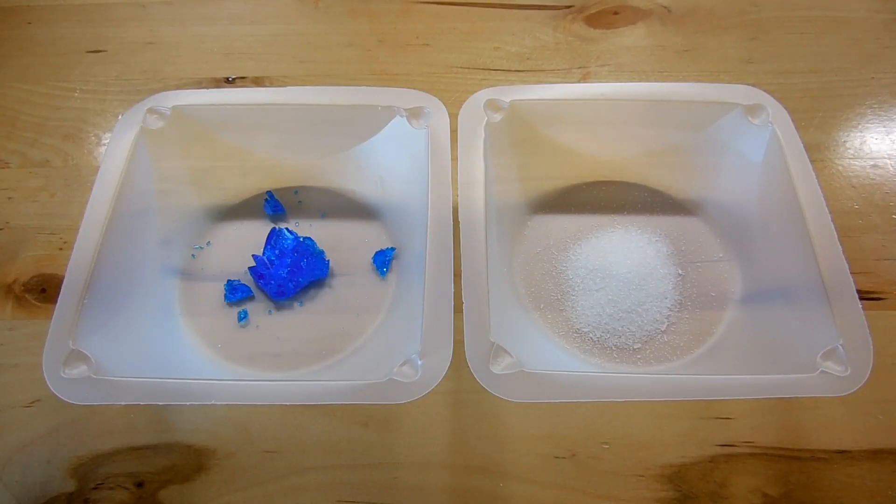Hey YouTube! Today I'll be making Chevreul's salt, which is a very interesting salt of copper that has an unusual color and a very unusual property to it that we'll talk about a little bit later.